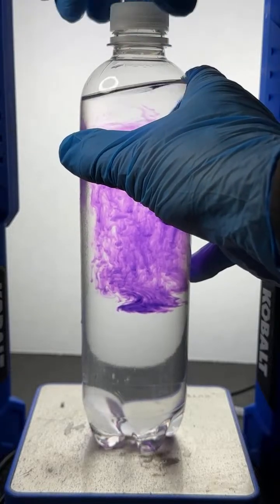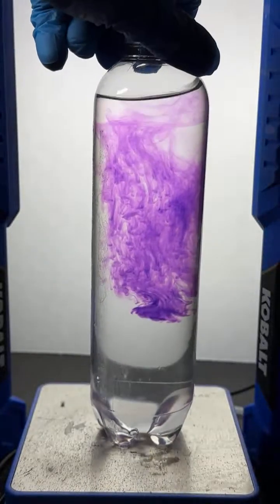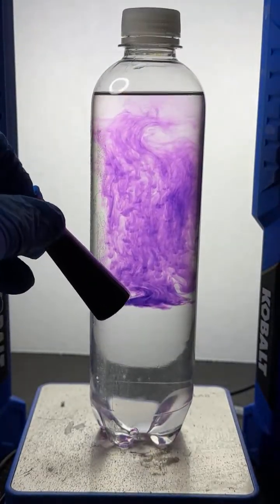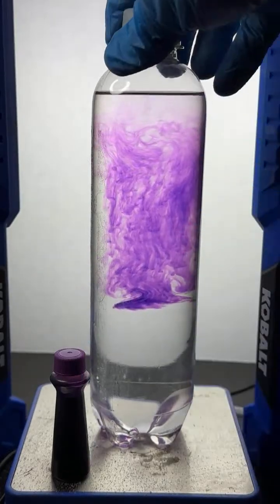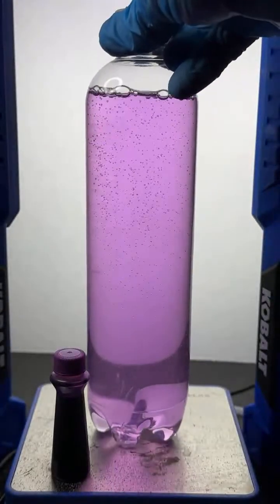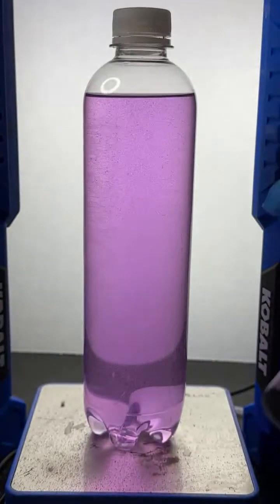All right, so to recap, what's in this bottle? What's in this bottle is a drop of neon purple food dye. There's some alcohol that I poured on top of some water. And if I mix this up, we see that everything mixes perfectly. So the dye mixes very well throughout the mixture of alcohol and water.